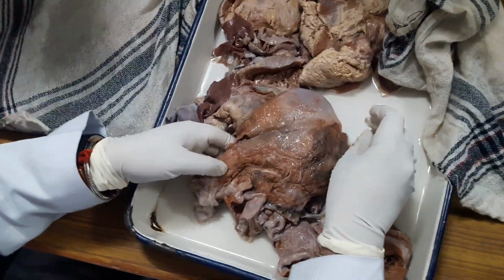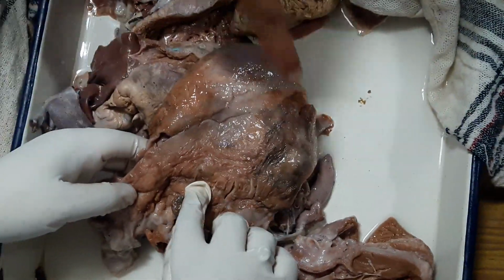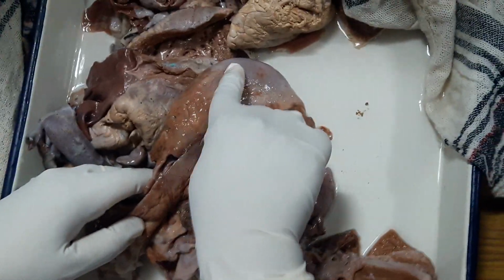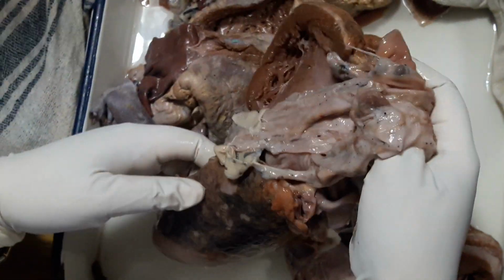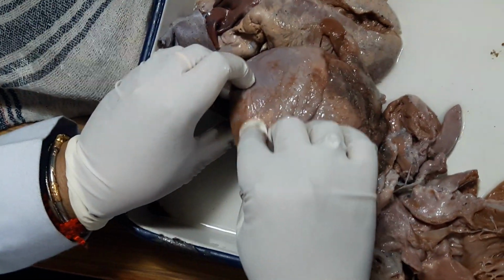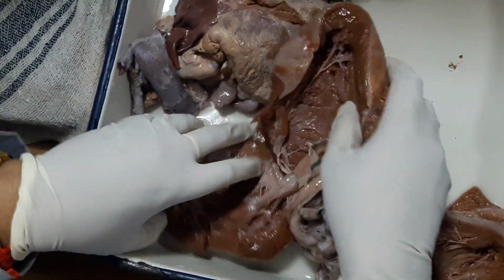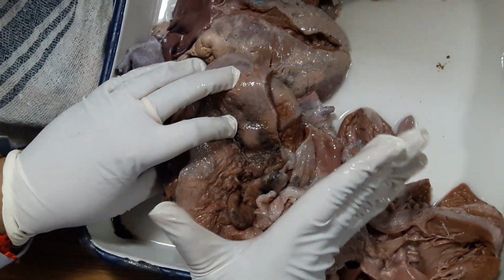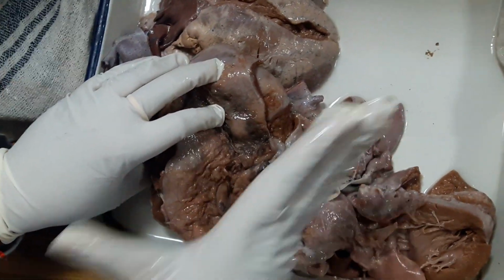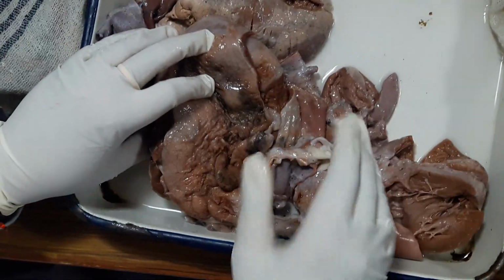Hold it in anatomical position. What can you see here? Necrosis. Fibrinous pericarditis. Oh. This is how it looks like. Okay. See, the visceral layer of pericardium is looking rough and shaggy. Okay. Now this hemorrhage in the base may be due to a terminal procedure, because when the patient dies, just before the death, the patient gets vigorous cardiopulmonary resuscitation. So sometimes there can be hemorrhage near the base.